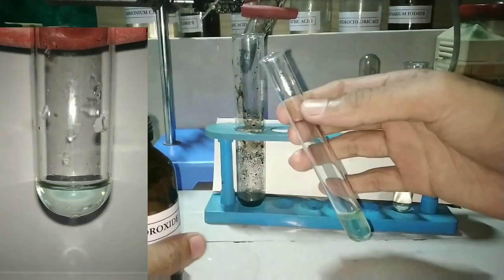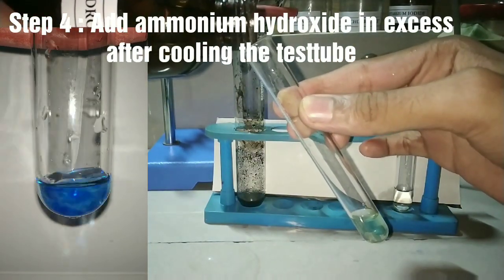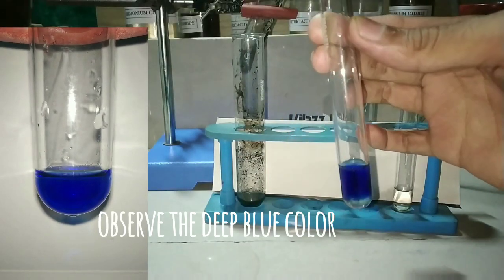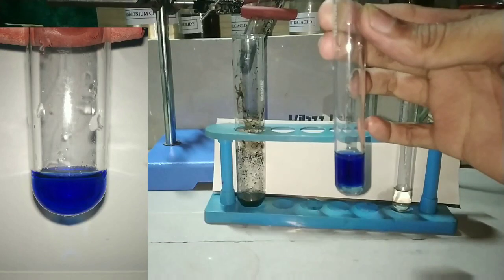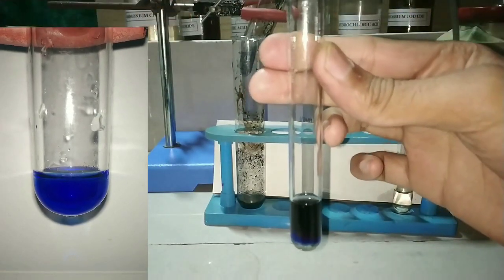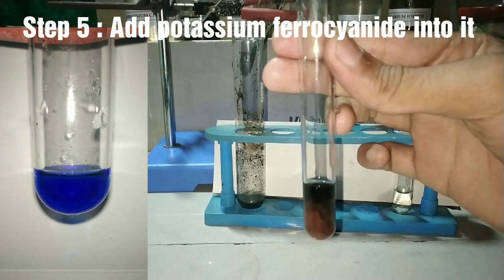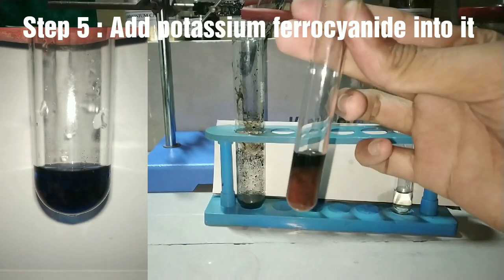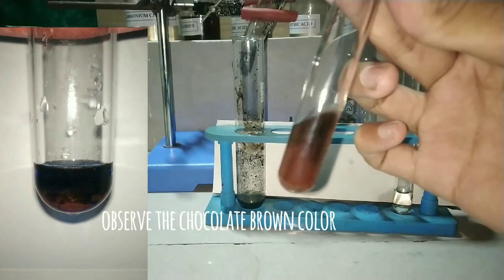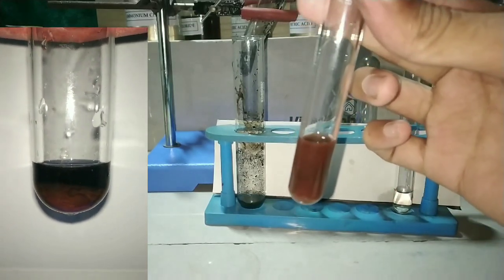Into this solution we will be adding ammonium hydroxide after cooling. After cooling the test tube we are adding the ammonium hydroxide, and on adding the ammonium hydroxide we get a deep blue color. Into this deep blue colored solution we will be adding potassium ferrocyanide. You can see that there is formation of a chocolate brown color on adding the ferrocyanide, which confirms the presence of copper ions.